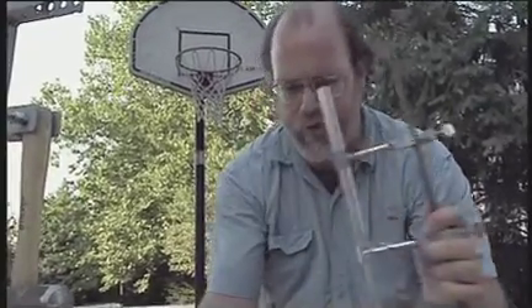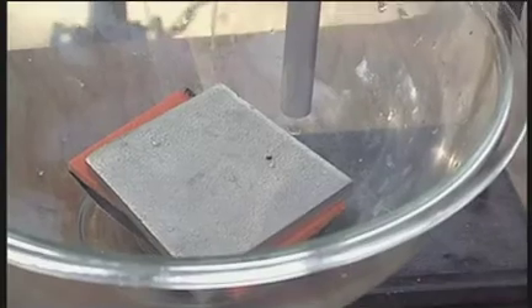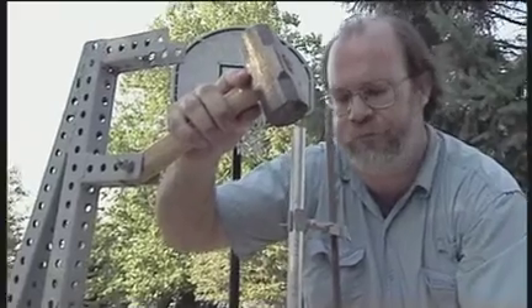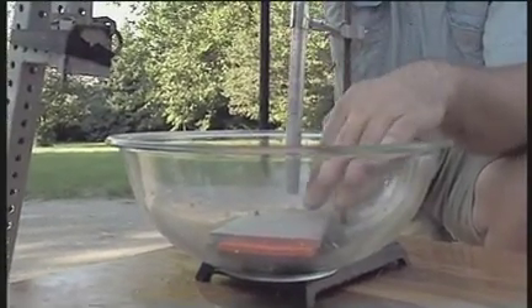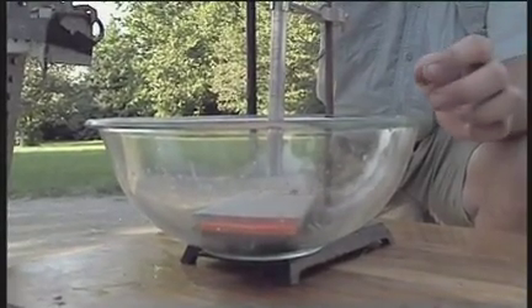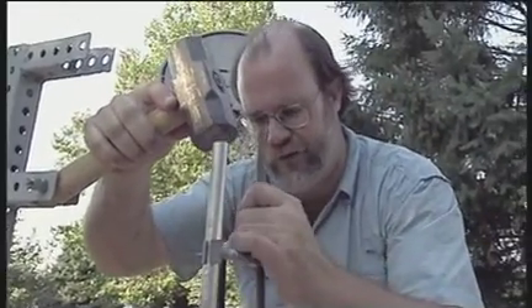So we were thinking we would smash them under water by putting a nickel plate in here that we happen to have lying around, put the ampule on top of that, and then have the hammer come down and whack the rod. That way — if you imagine that piece is the ampule — the ampule will be smashed under the level of the water and it can't possibly go anywhere before it reacts. And the sponge here will protect the glass bowl from being broken by the hammer.